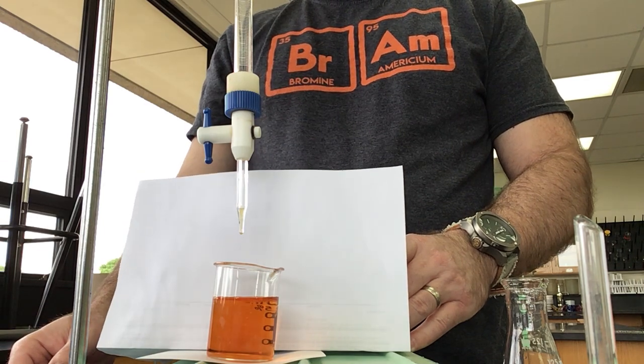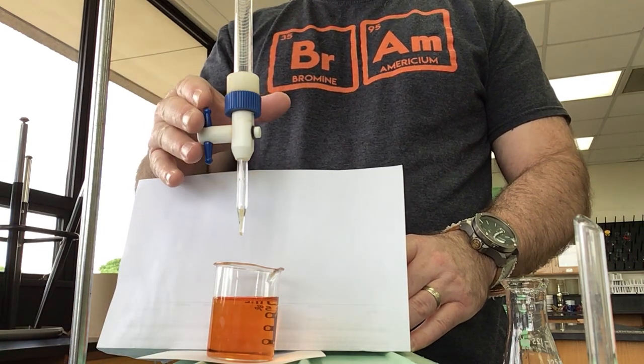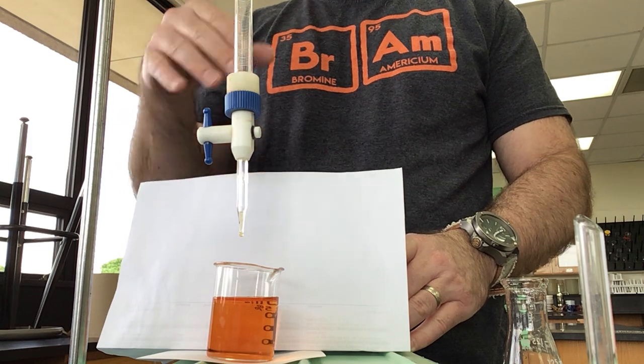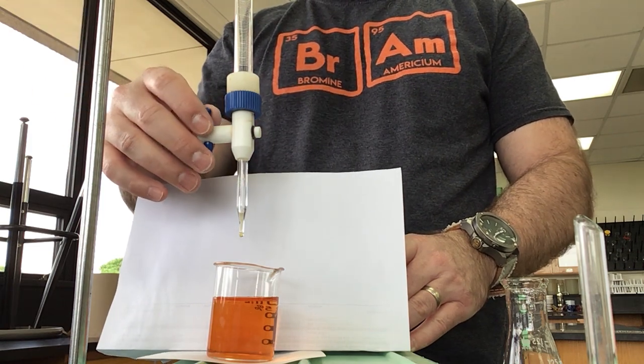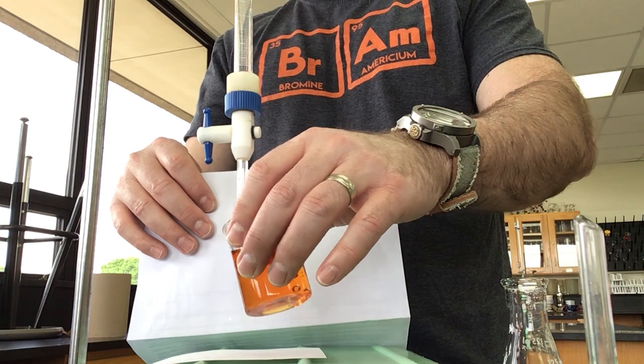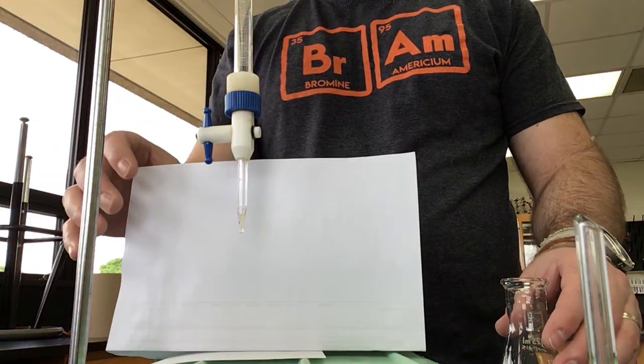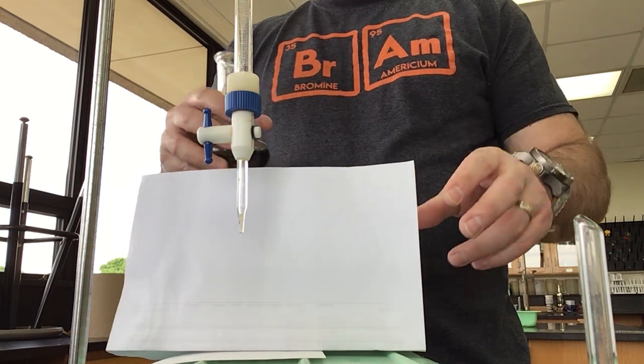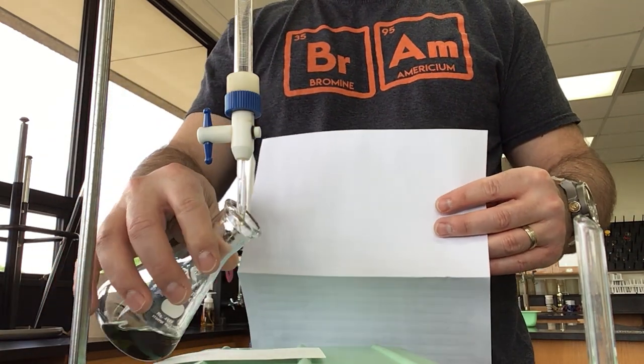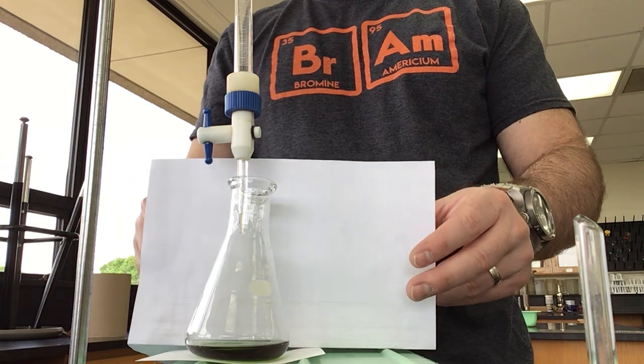That would be an option. It's not the best—this is a lot more controlled and you can do this and then start cleaning up your lab in another way. All right so I'm going to move that aside and grab another beaker that I'm not concerned about using. This is just the leftover titrant that I had from before.